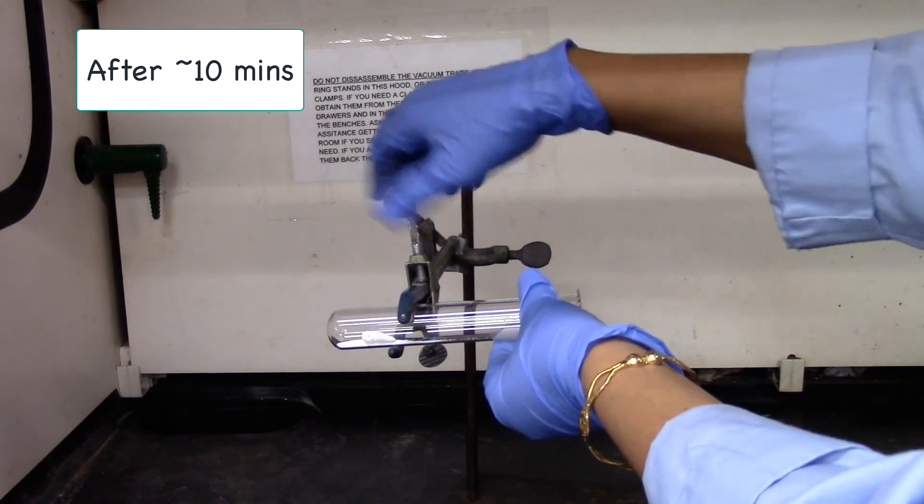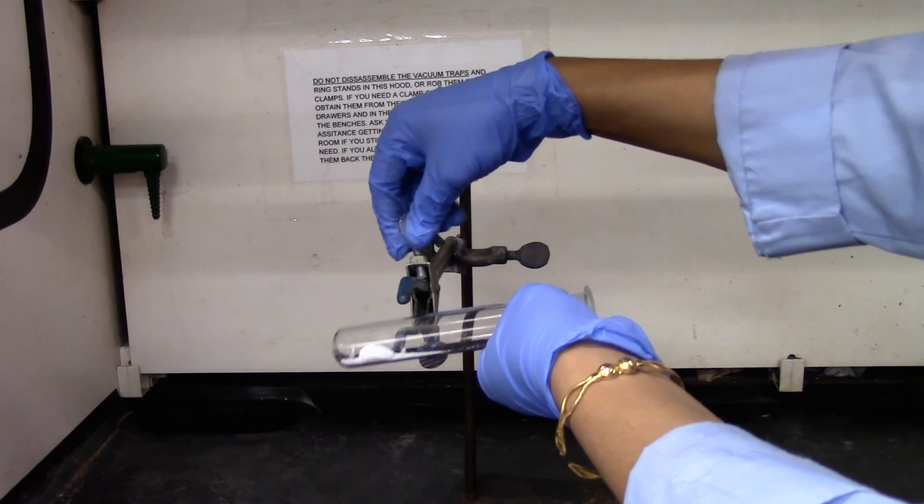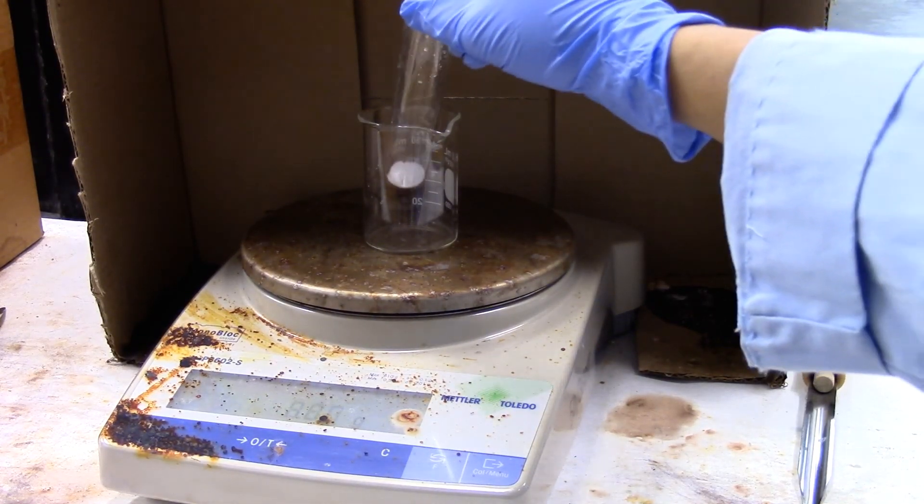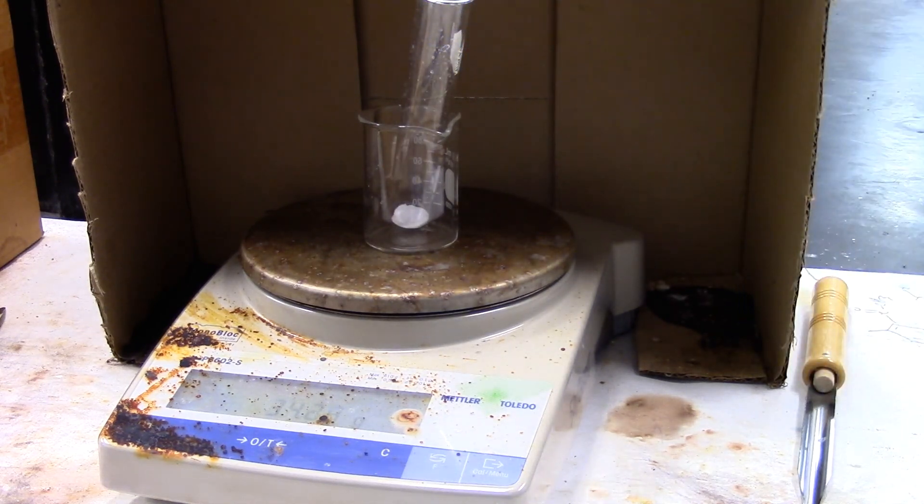Now the test tube has cooled down. We'll go ahead and weigh it. Tare the beaker. Place the test tube with the product.